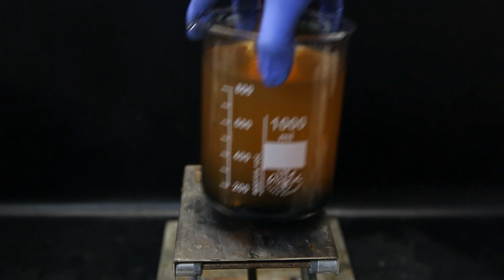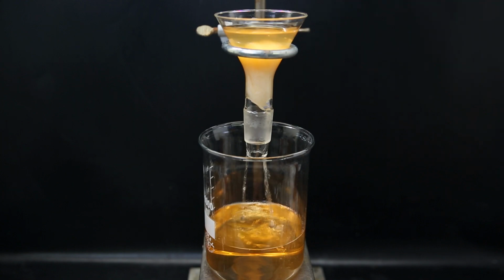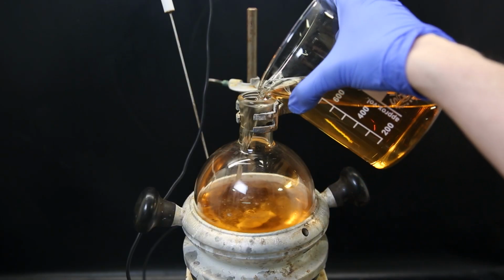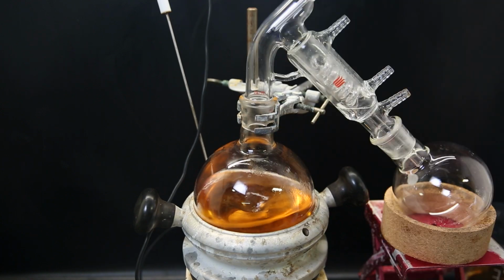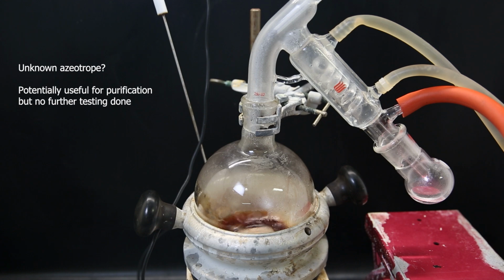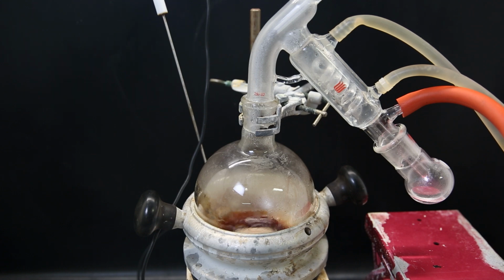I then take this mixture and filter it all through some cotton into another beaker. I then move this filtered liquid in portions to a 1 liter flask and distill off all of the ethyl acetate. When most of the ethyl acetate was gone, it seemed that some of the amine co-distilled with the ethyl acetate, the lower the volume became, even though the amine has quite a high boiling point. At one point, all the ethyl acetate is gone, and thus also the amine stopped coming over with it.